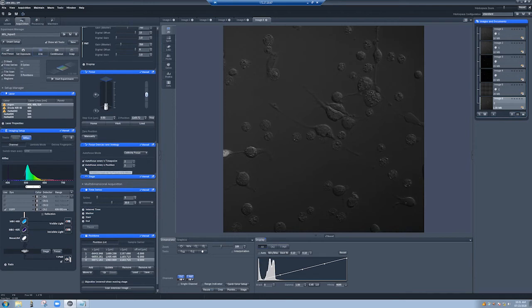And we're autofocusing every time point, and every second time point, and every second position. So let's start the experiment and see what happens. Actually, I'm not sure if this is... I'm not sure what this means.